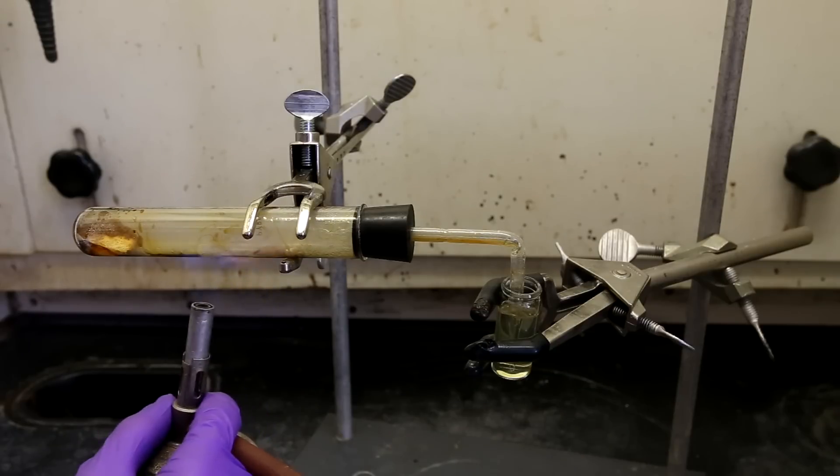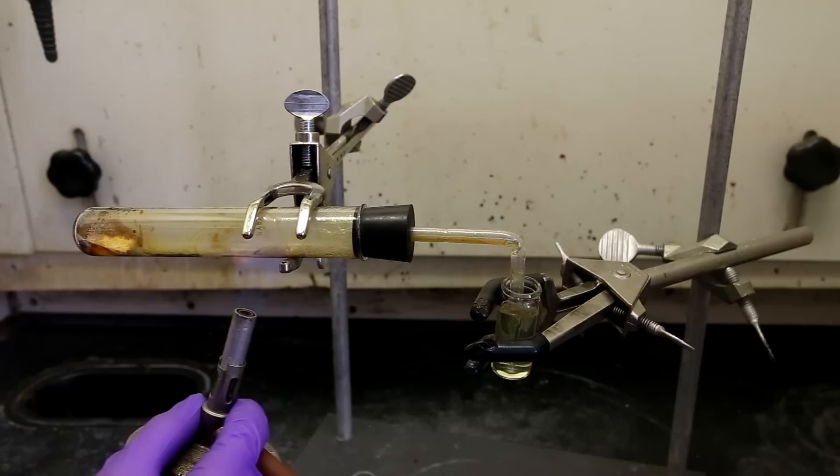Depending on how hot the test tube is, it can rupture when the cold water hits it. Luckily for me, everything worked out fine.